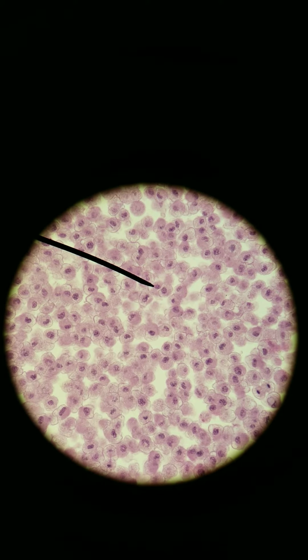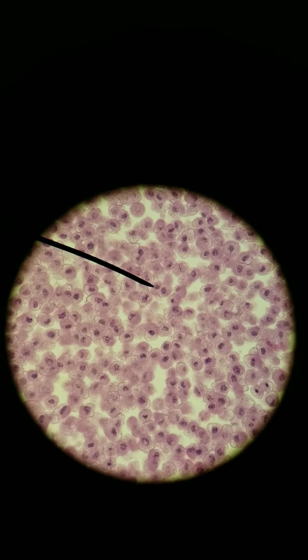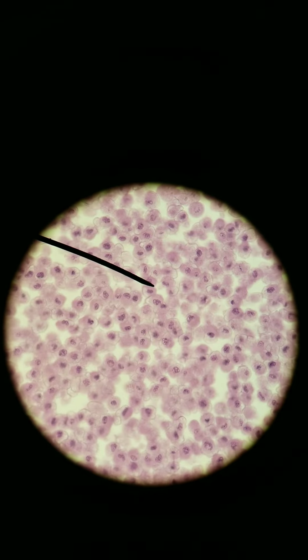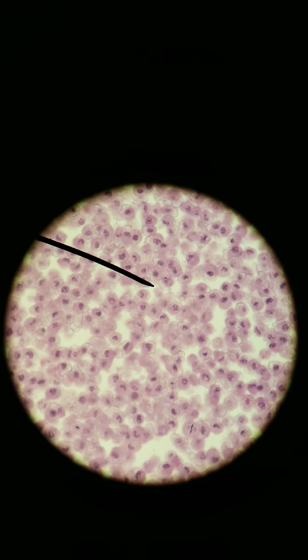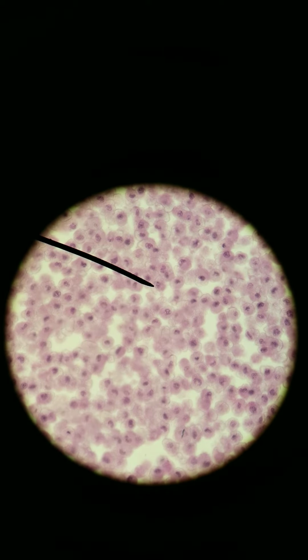But let me go find one in prophase, the first stage of mitosis. We want to look for chromosomes that have been condensed, but they're all still in the center. So I'm going to move down a little bit. Move the arrow here. I would say this cell here has nice, distinct chromosomes. So that is a good example of prophase.